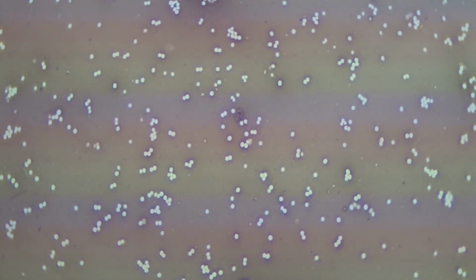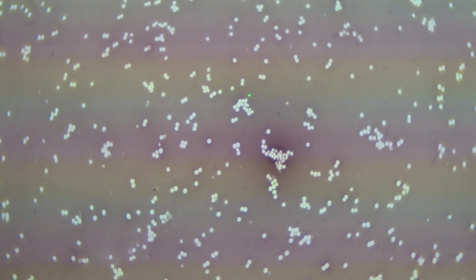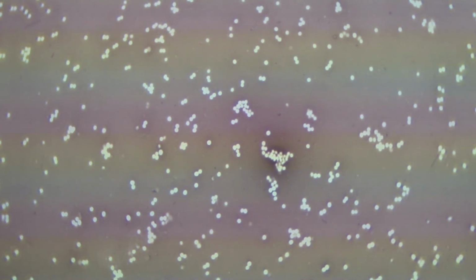I'm going to trade this slide out for the simple negative smear I made of Staph aureus. And recall that Staphylococcus aureus now is a ball-shaped cell in a grape-like cluster. That's what staphylo, S-T-A-P-H-Y-L-O means, staphylo. And here, on a simple negative smear, you get to see those grape-like clusters and resolve the individual cells within the cluster. And that's why this is such a powerful, simple stain for staph here. It allows us to not only note the cell morphology being coccus, but the cell arrangement being staphylo. And that is a lovely view.